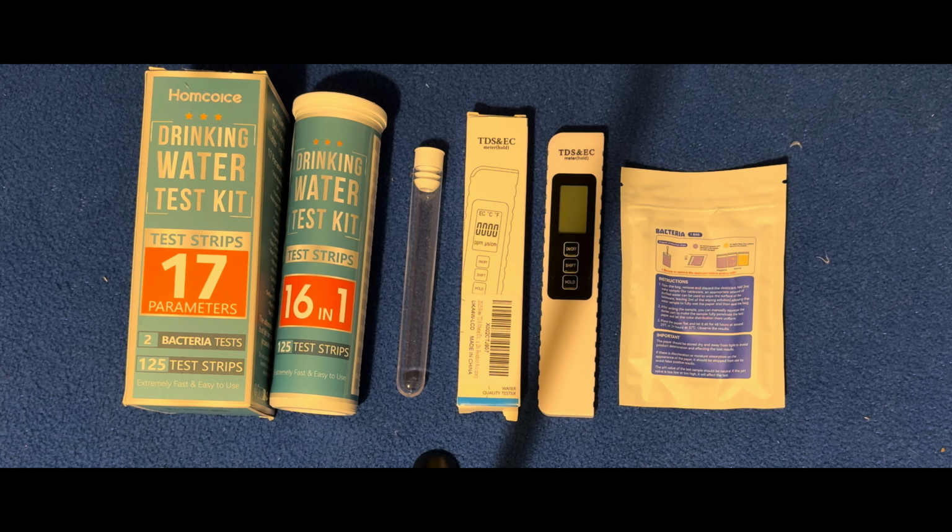So I hope you found the first 2 tests interesting. I thought it was particularly interesting that the actual tap water had more particulates, was harder than the spring water, which just goes to show, although the spring water had sediment in it, it still had fewer particulates. It was also interesting doing the chemical analysis that both the spring water and the tap water equally had no particular elements in it which could have long-term health risks.